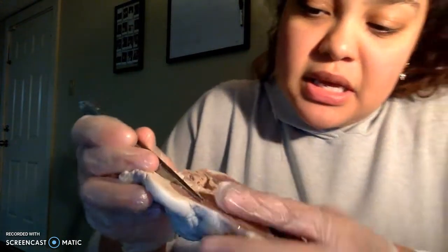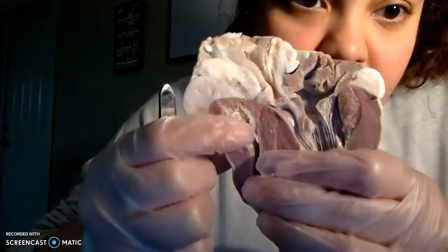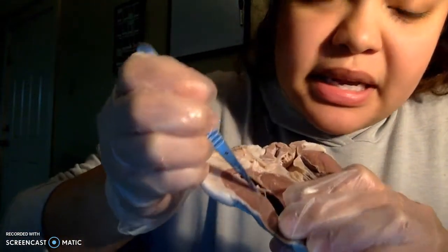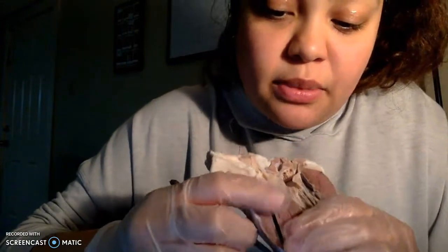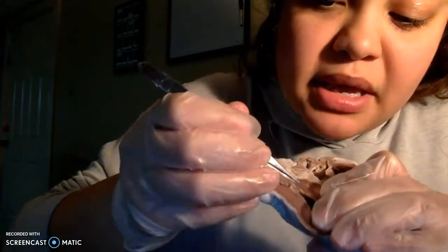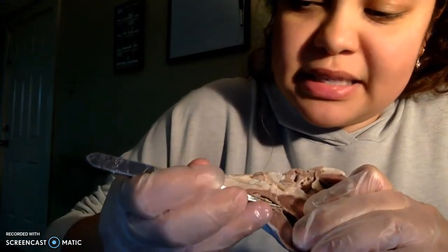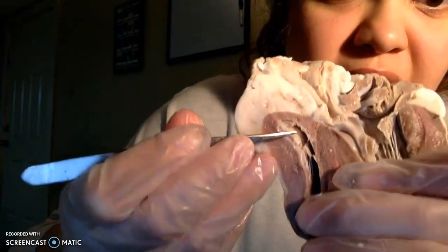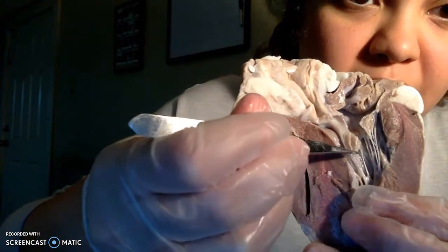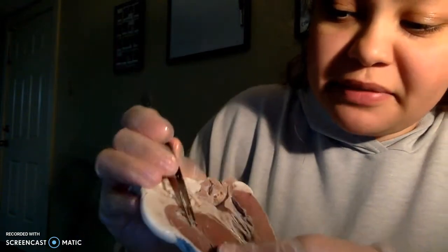portion of the heart. And we can see it up here, right there. It connects the right atrium and the right ventricle. So we can see that it is right there, right above the right atrium. And we can also see that we have some chordae tendineae, which are the string-like tissues. We can't see them that well over here, but we can over here. I am right there, the part that I am touching, the string-like tissues.